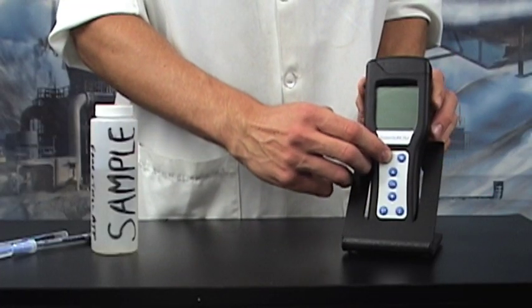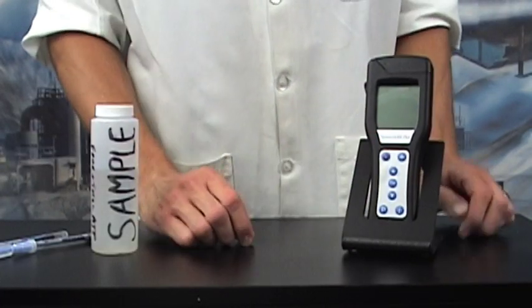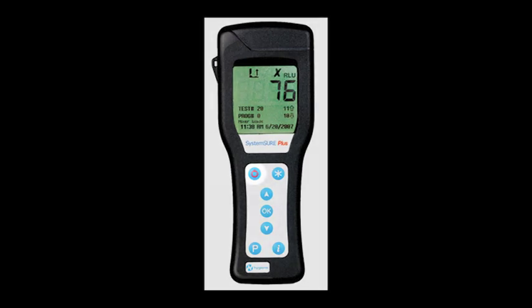Turn on the unit. Oh, put the batteries in first. Turn the meter on by pressing the on button.